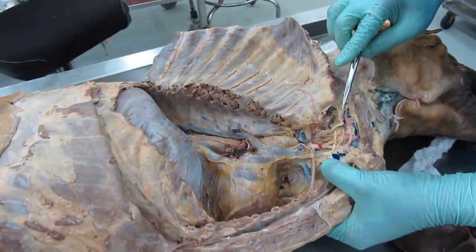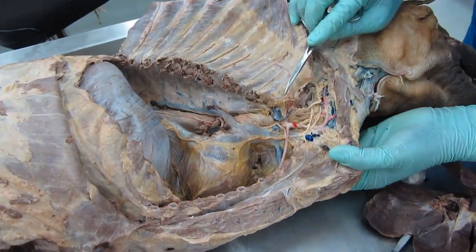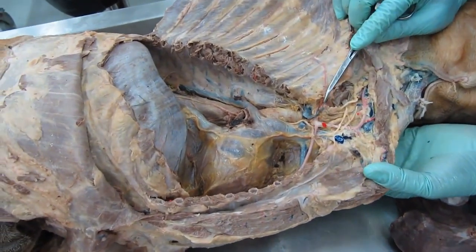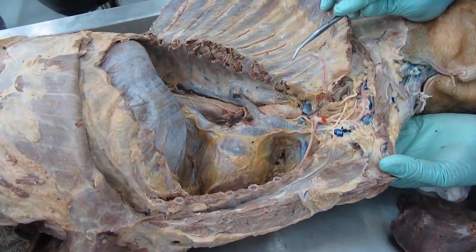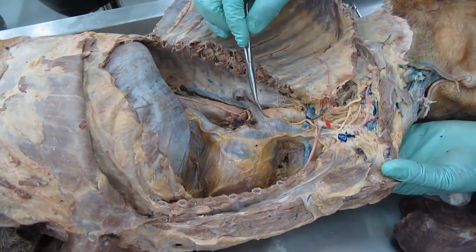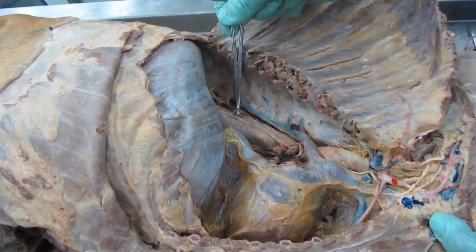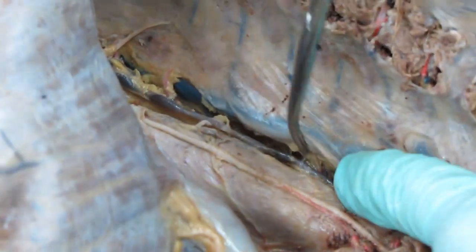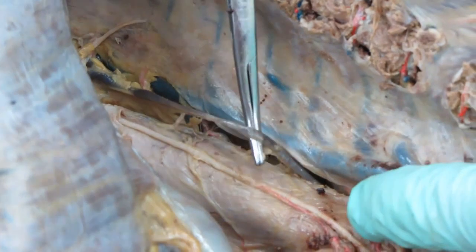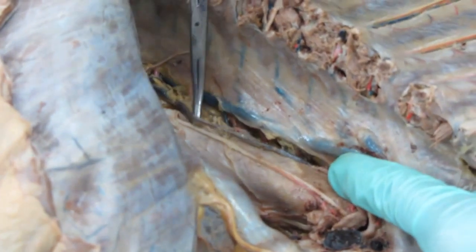Okay, so we'll look at the brachiocephalic trunk and a few other things on the right side. Most of them we have already seen on the left, but some would not be present on the left side, which are specifically on the right, like your azygous vein. And this specimen also shows a very good thoracic duct, the right side part of the thoracic duct, present right below the azygous vein. The slightly blackish tinged vessel is your thoracic duct.